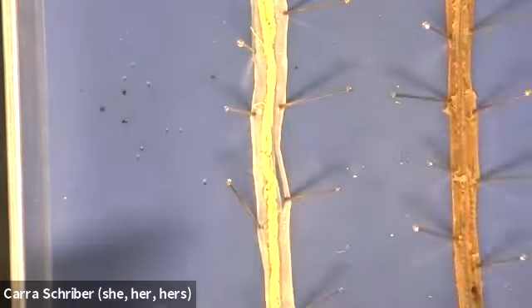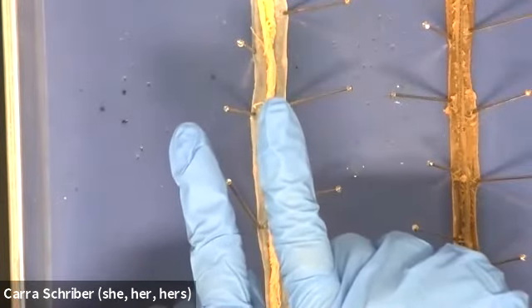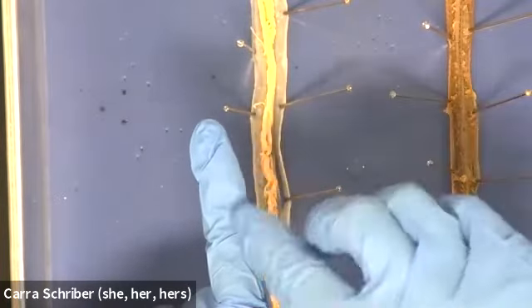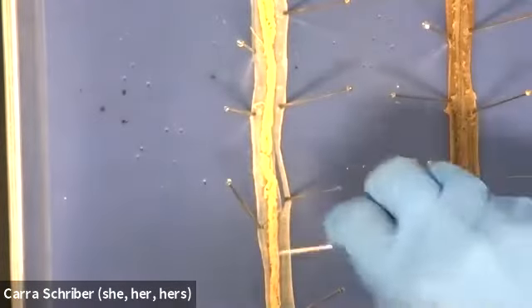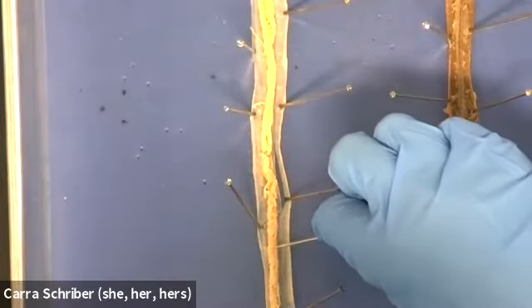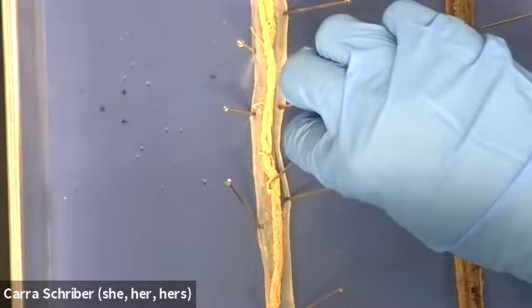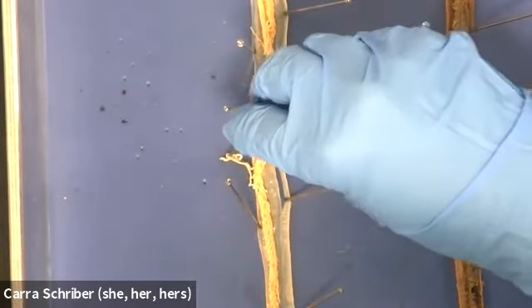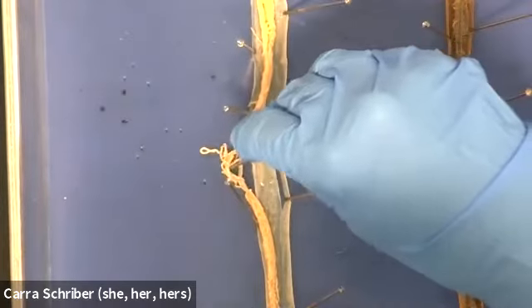But they don't come back together fully. They sit next to each other, they get close. I apologize, that wording was kind of confusing. And then from these big, large tubes, they get really, really small, and they become these thin string-like coils that coil up. Can you see those? They're like little spaghetti strands.